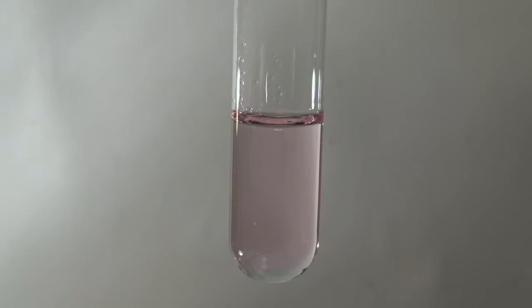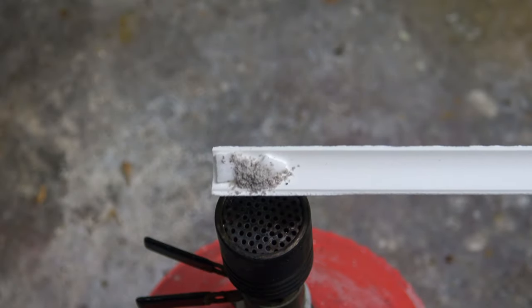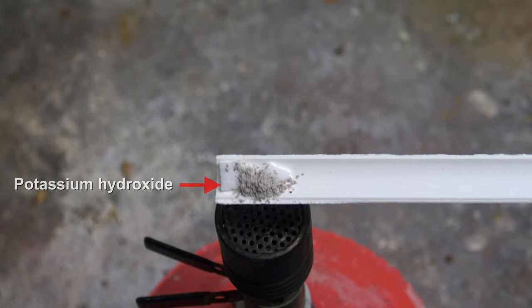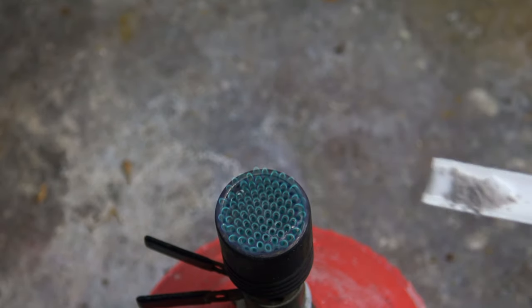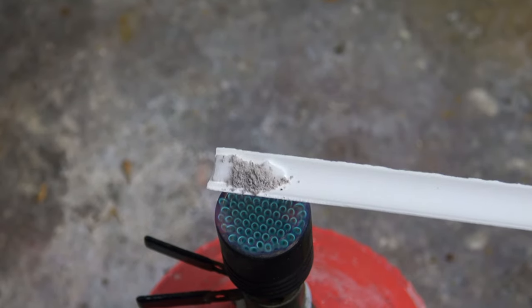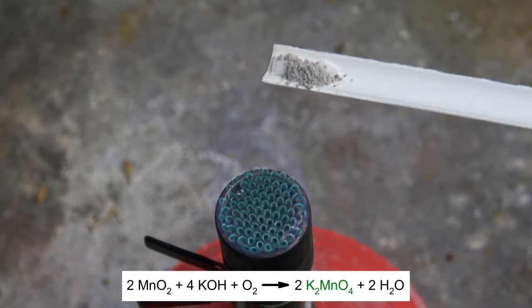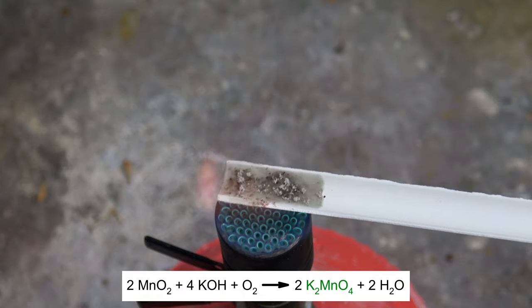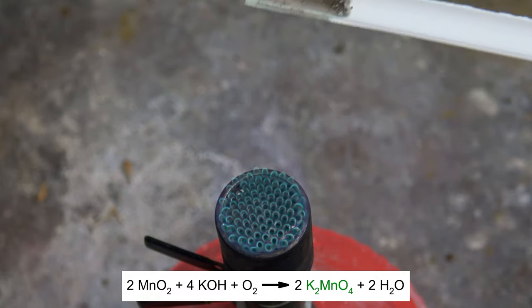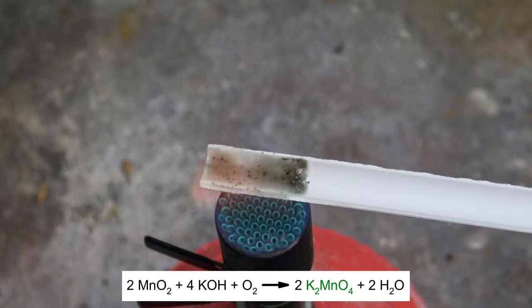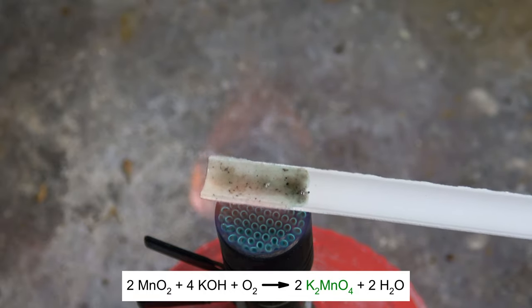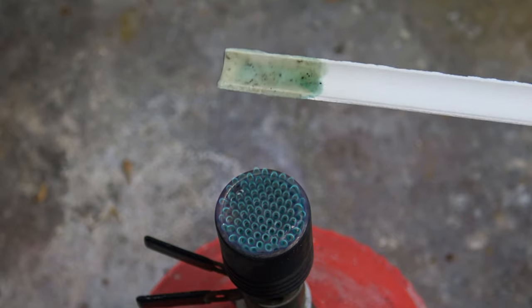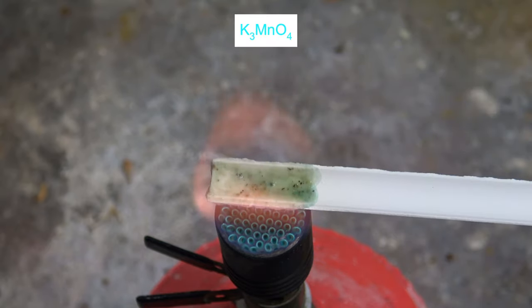A simplified version of this test can be done like this. Some potassium hydroxide was added on a piece of magnesia and some ash on top. Then it was heated on the Bunsen burner. Here the manganese dioxide is oxidized by the oxygen from the air, which leads to the formation of the green potassium manganate. The change of the color to blue is due to the formation of potassium hypomanganate-5.